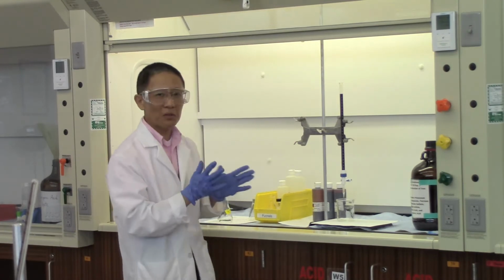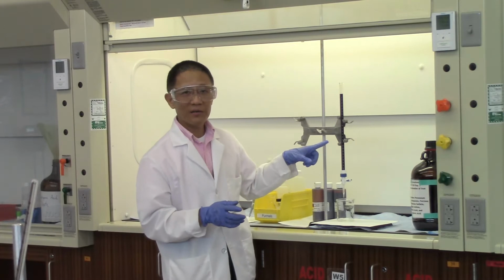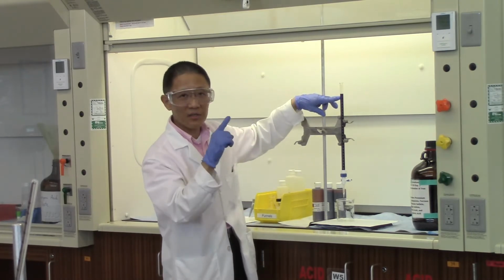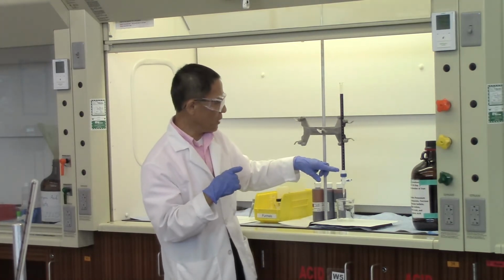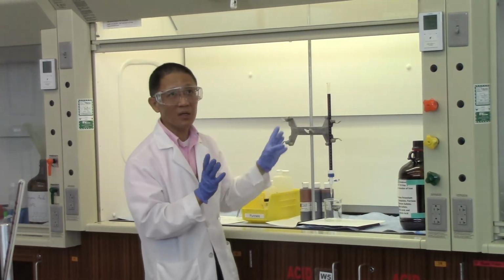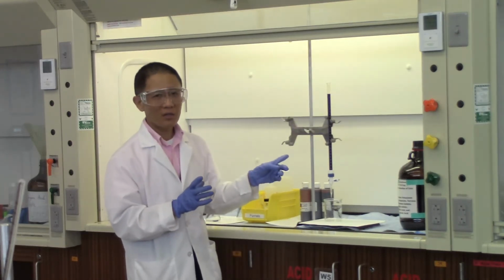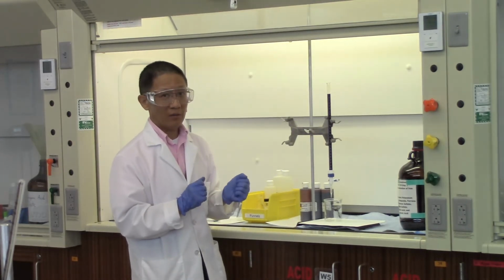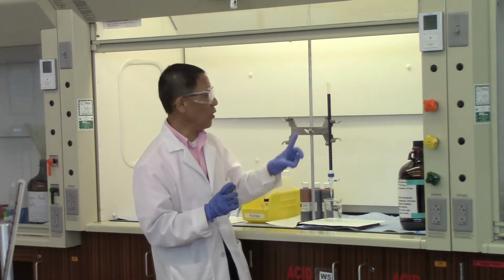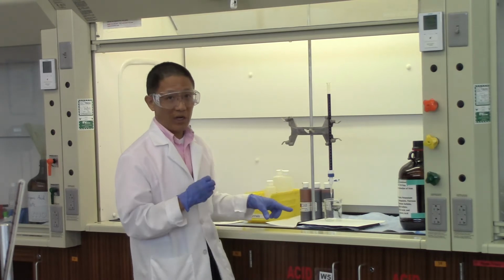Now, just a quick review for the titration part. Once you fill up the burette, on top it says 0. On bottom, for this particular burette, it says 25 milliliters. So you can have as much as 25 milliliters of solution in here. But how much the burette holds isn't really something we care about. What we're trying to figure out is how much we are adding from the burette into the reaction mixture.